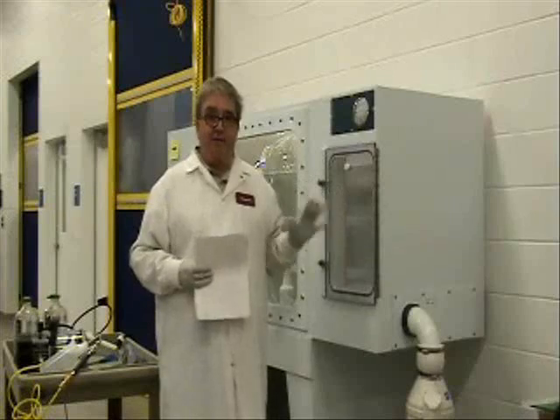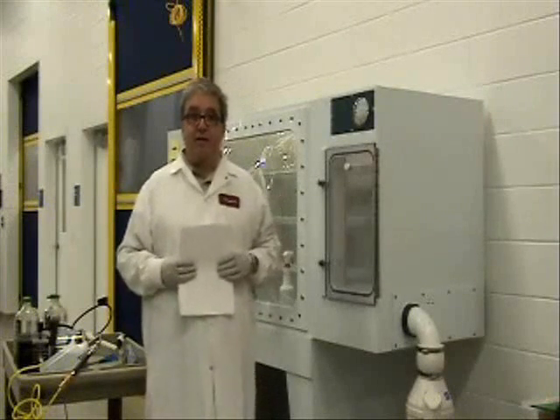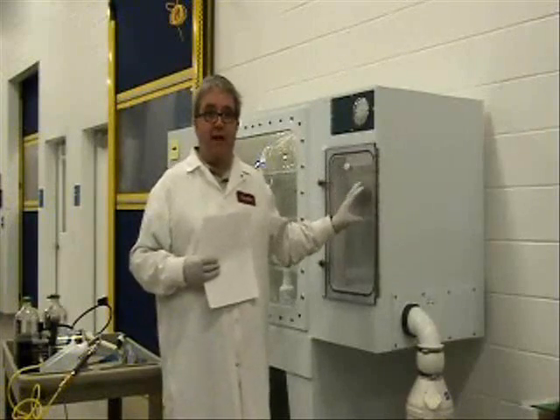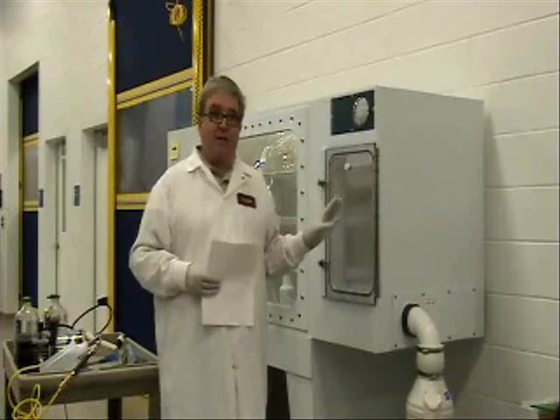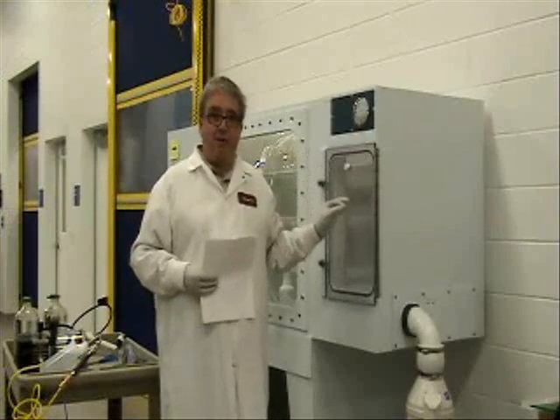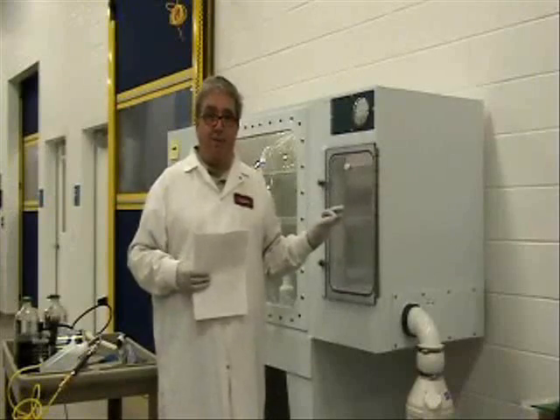At this point I'd like to highlight a key difference between sterilizing a semi-rigid and a flexible film isolator. Typically, when you have a flexible film isolator, the filter has already been sterilized and there's a procedure for installing it involving puncturing a mylar film. We're not going to cover that here. On a semi-rigid isolator, the filters are not sterile, and you're sterilizing them in place — that is one of the key differences.